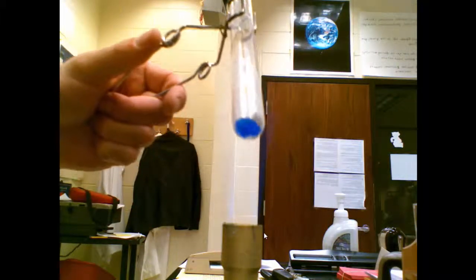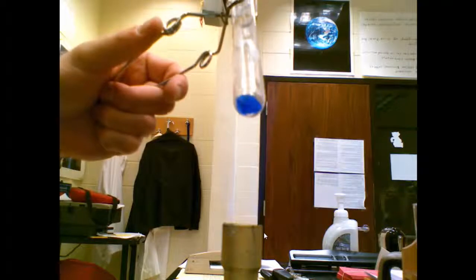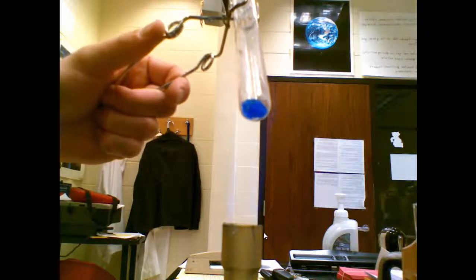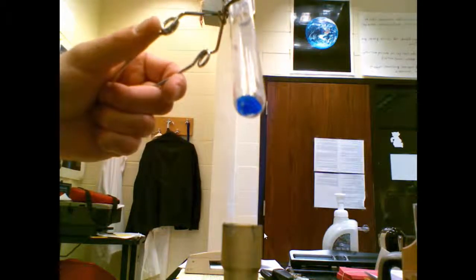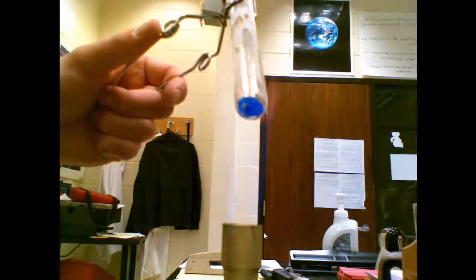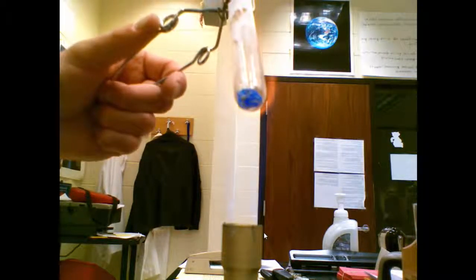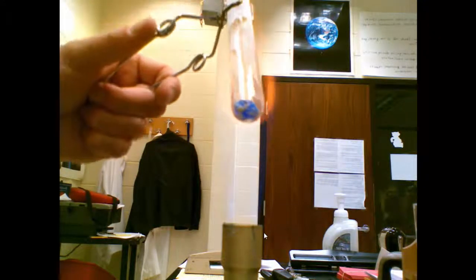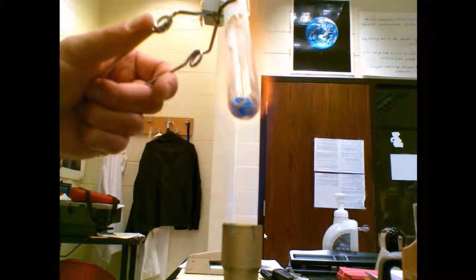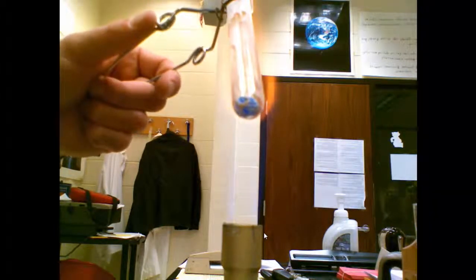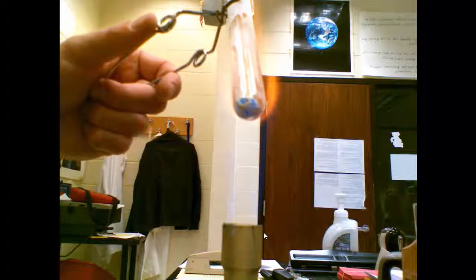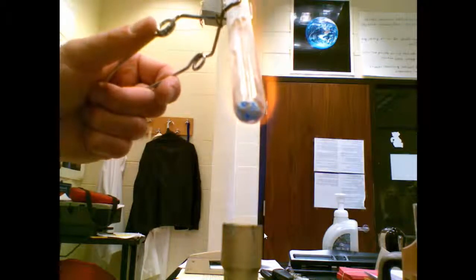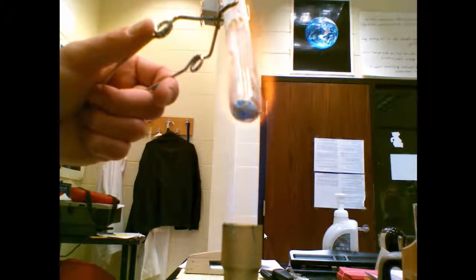Crystal number six. It's a blue large crystal. This was a singular crystal instead of a powder or filings. Okay, the flame is starting to turn yellow and still no melting. Flame is yellow, no melting. We can't melt this crystal in our Bunsen burner.